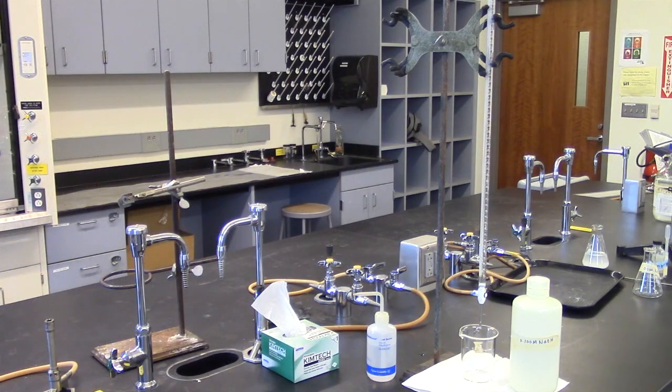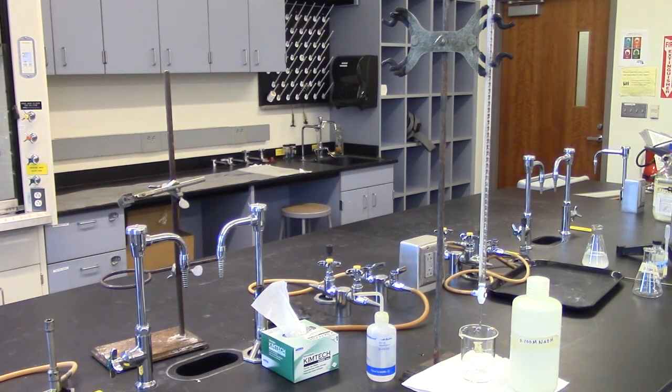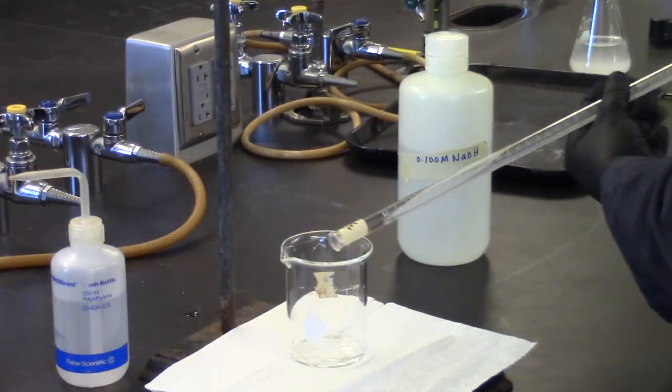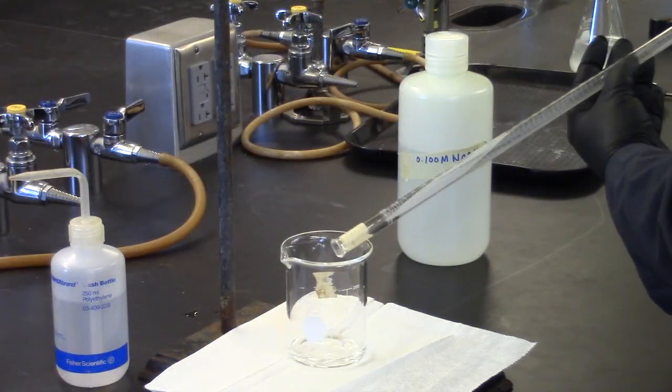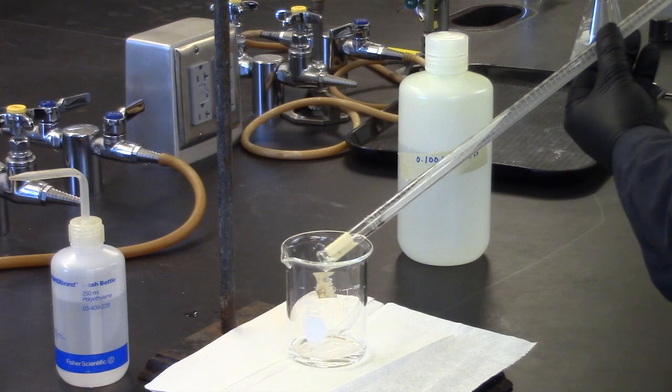Next, the burette is set up using your standardized sodium hydroxide. Rinse burette three times with sodium hydroxide, fill, and remove any air bubbles in the tip.